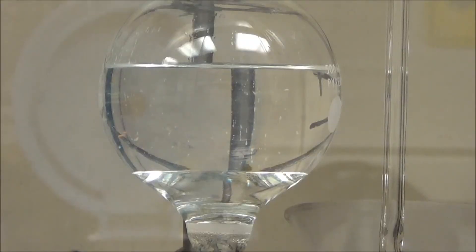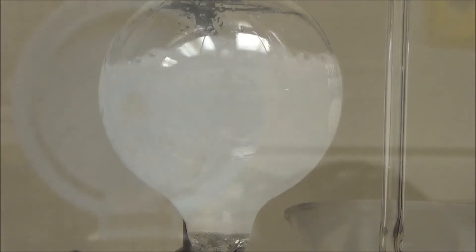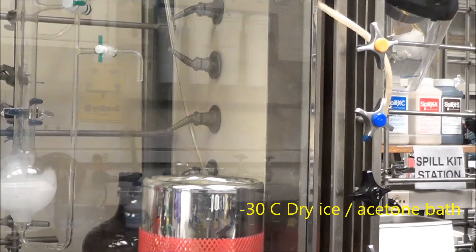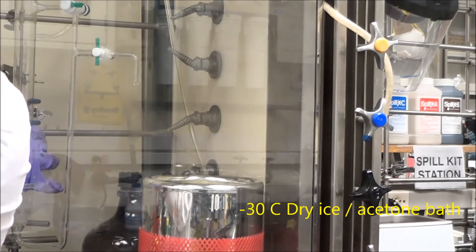And here's the crazy trick. You see, oleic acid and acetonitrile don't actually mix. So you have to violently bubble nitrogen through the frit to artificially make them mix, at which point you can then recrystallize them here in a minus 30 degree dry ice acetone bath.